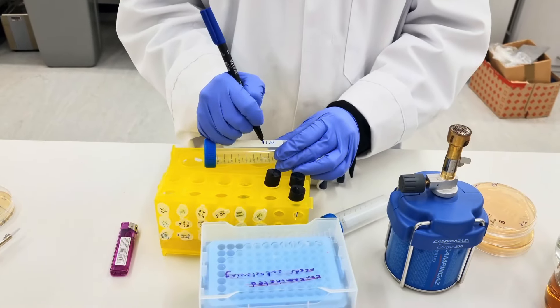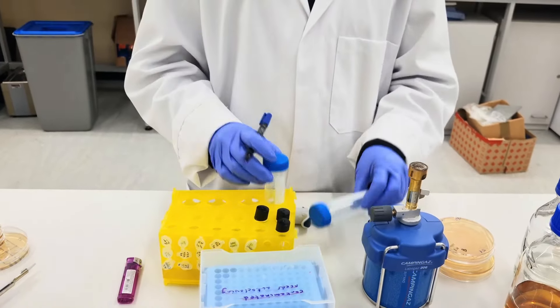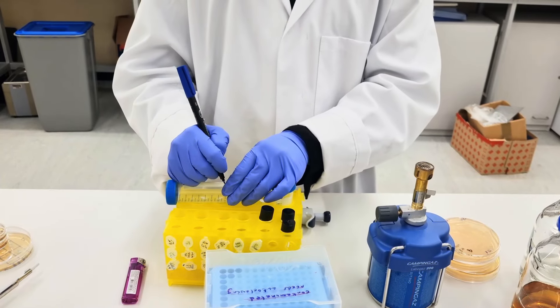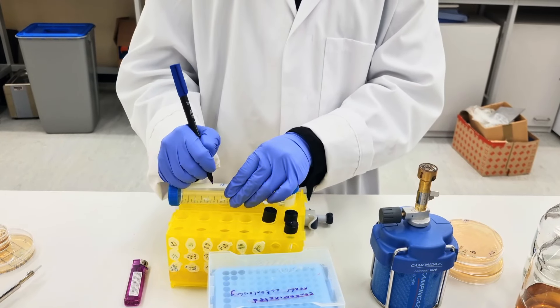So now I'm labeling them as one is YPD and one to be the triple amino acid dropout.